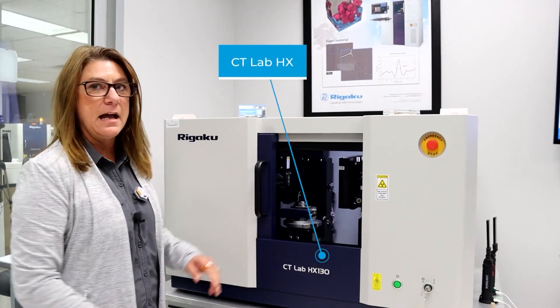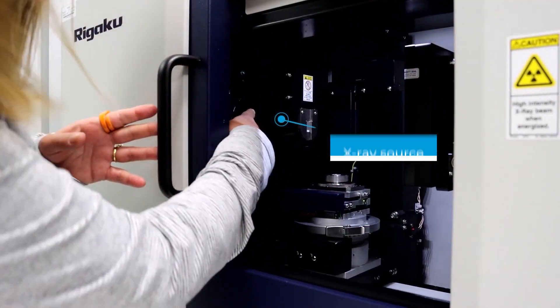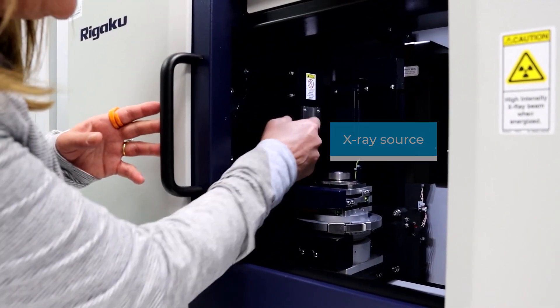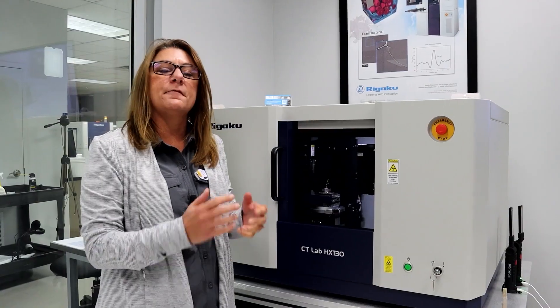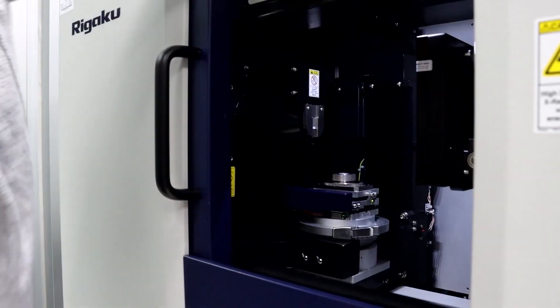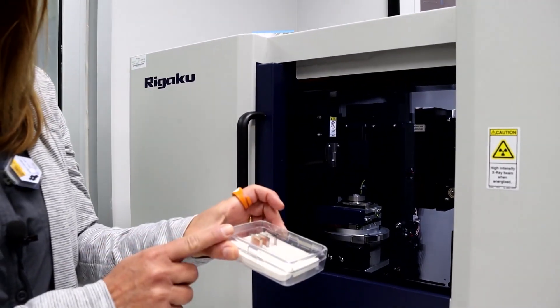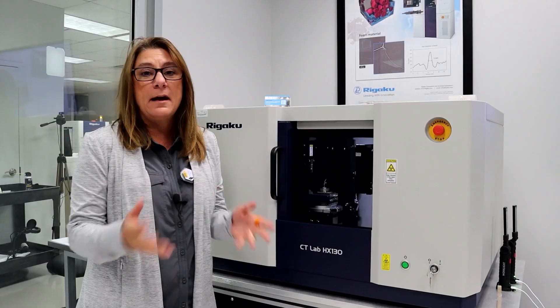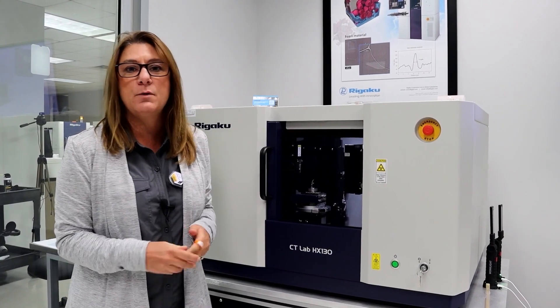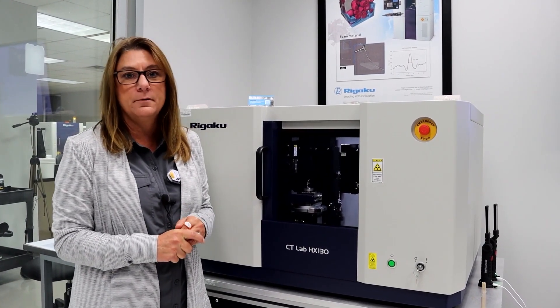This is the CT Lab HX instrument. Behind this barrier is where the x-ray source is. We can insert filters here — we would use a different filter when we change energy. We have a range of filters. For example, for high energy you might want to use an aluminum filter. You might also choose a filter based on your sample type; for instance, if you were imaging a battery, you might want to use a thicker copper filter.